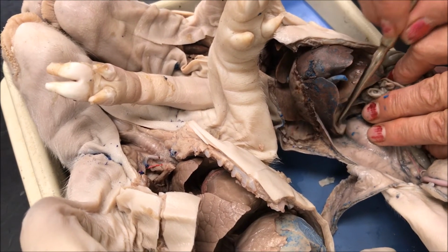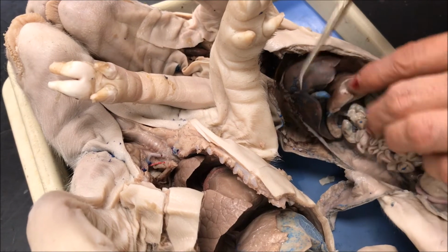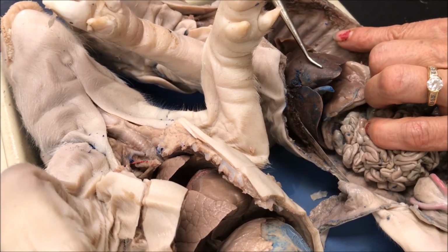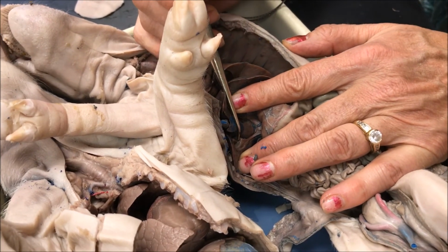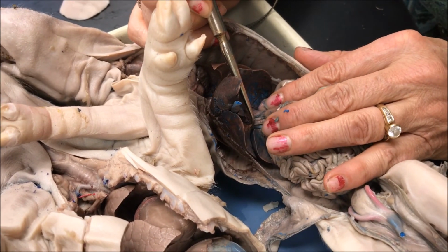The pancreas secretes lipase, which enters here, and the bile is also secreted here to digest the food. The liver is really big in the fetal pig, and it has three functions: store glycogen, secrete bile, and secrete enzymes. And then this little green bag underneath is the gallbladder, which concentrates the bile. There are three ducts: cystic, hepatic, and common bile, and those are for flow of bile.